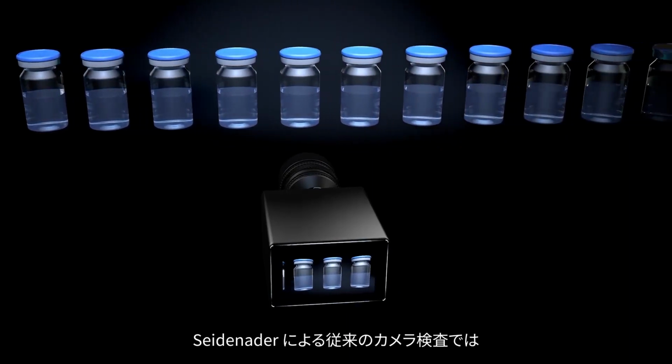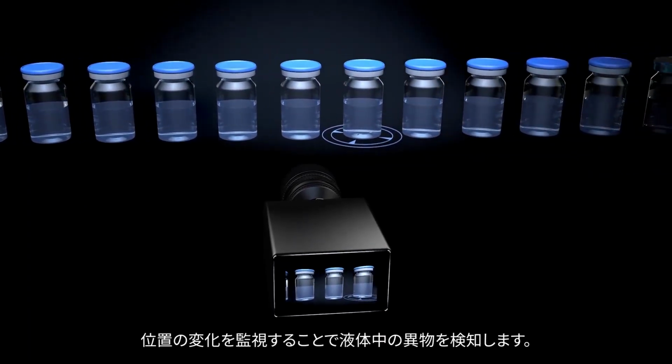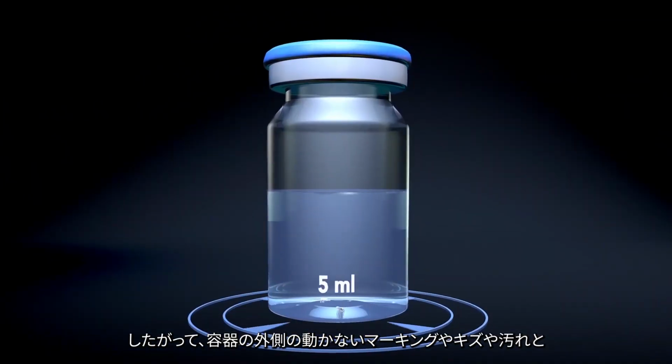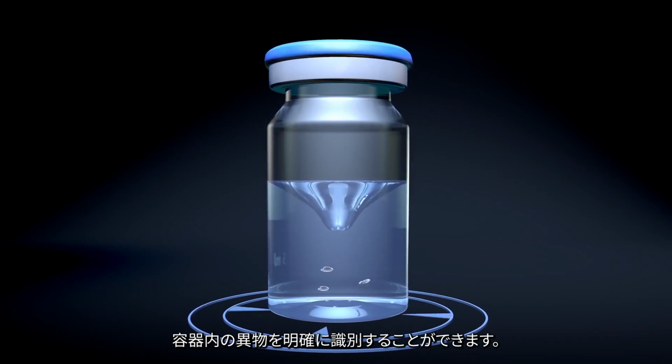The principle of particle inspection for liquid products. Conventional camera inspection by Seidenader solutions identifies particles in liquids by monitoring their changes in position. Stationary markings, scratches, or contamination on the outside of the container can therefore be clearly differentiated from particles inside the container.